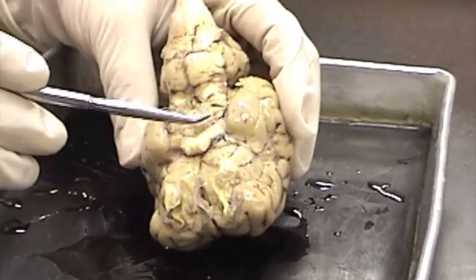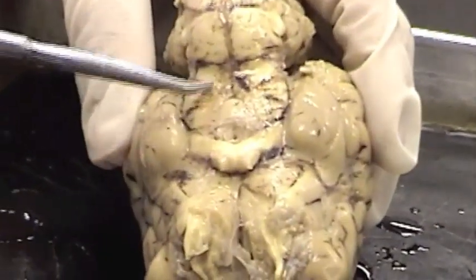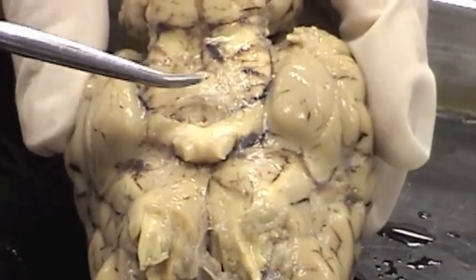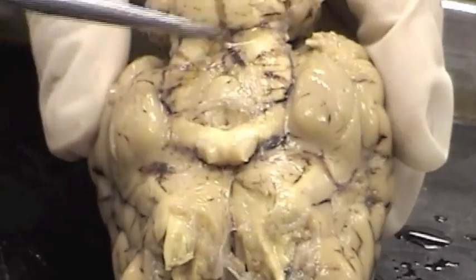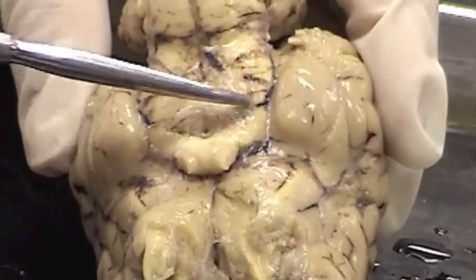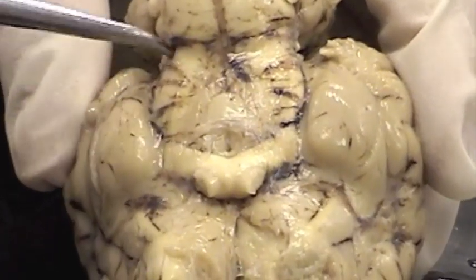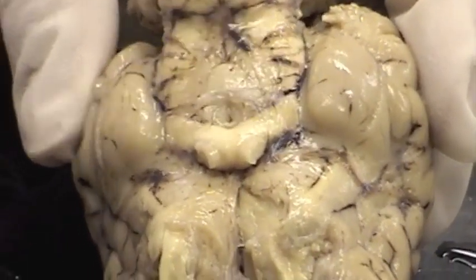Here we have the cerebral peduncles. Remember that the cerebral peduncles are found on the ventral side of the brain. We find them forming a V on either side of the mammillary body — they are swellings. Here is one and here is another.